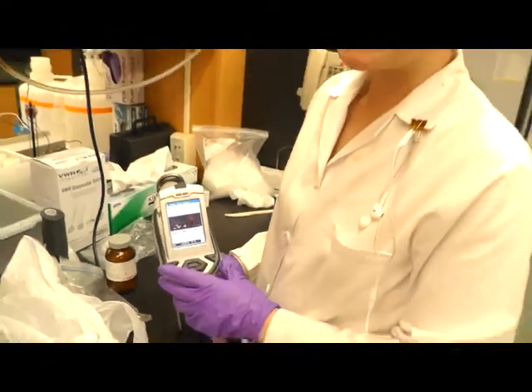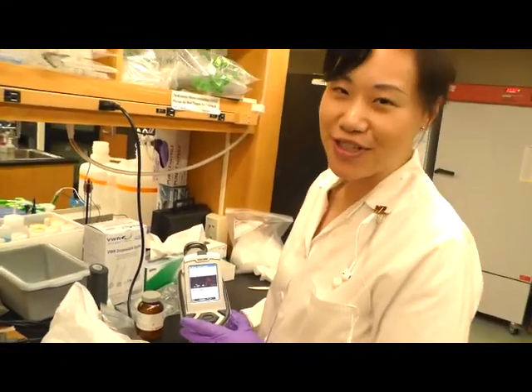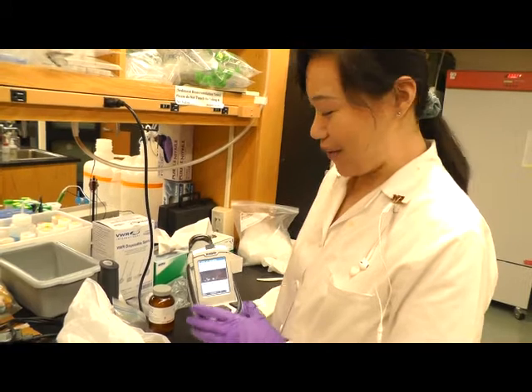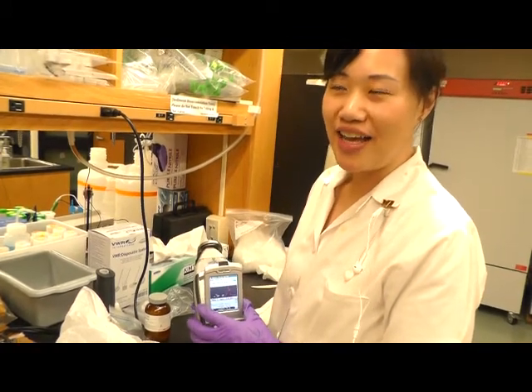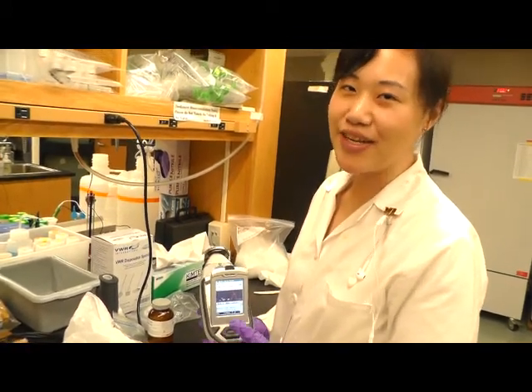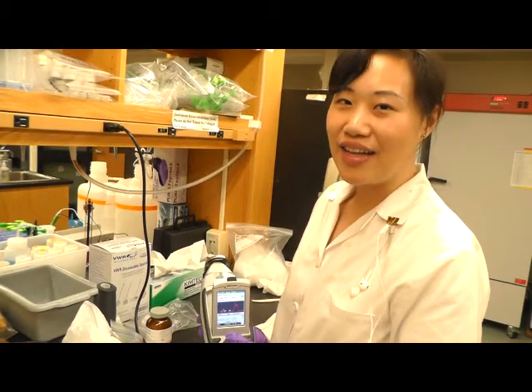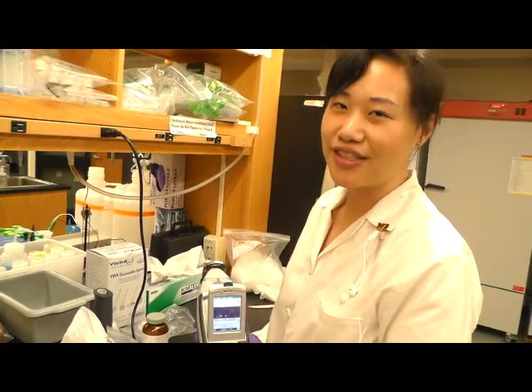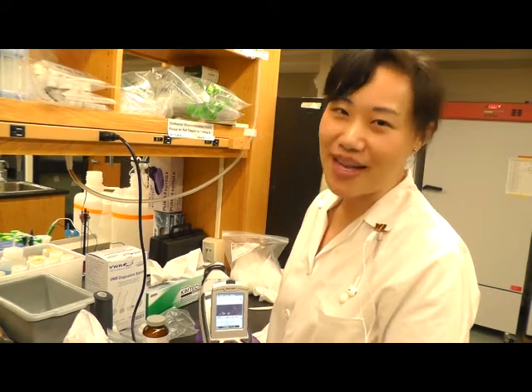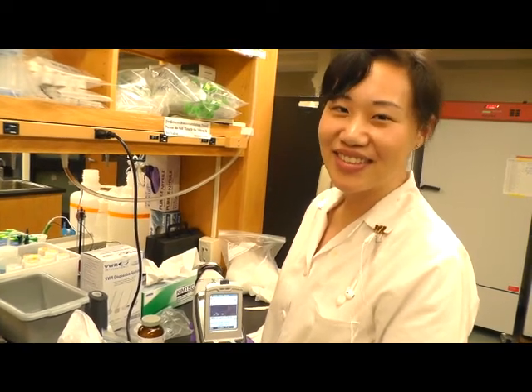So that's the end of our demonstration today. And I hope it will be helpful for you in using XRF, which is a really handy and helpful measurement of environment samples. Thank you.